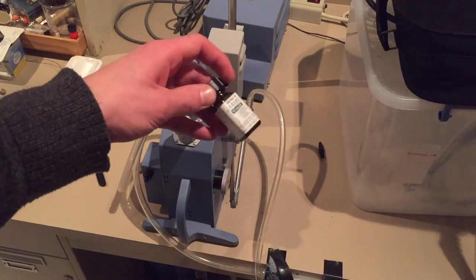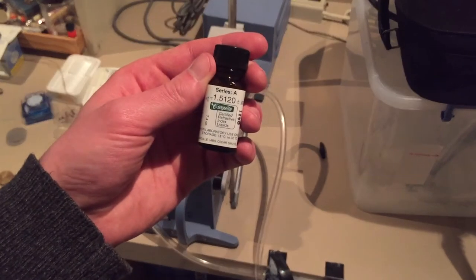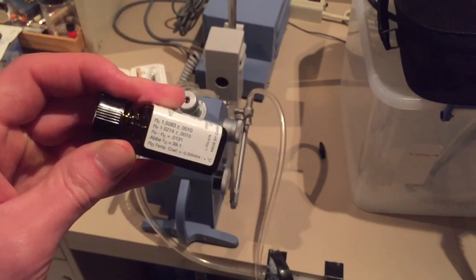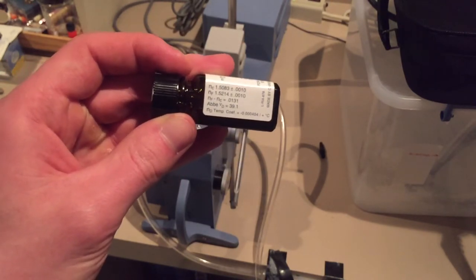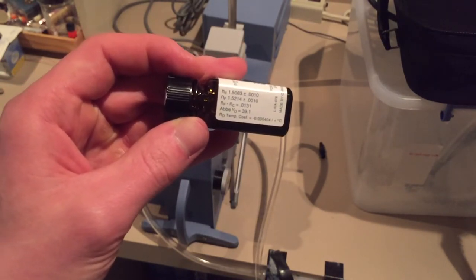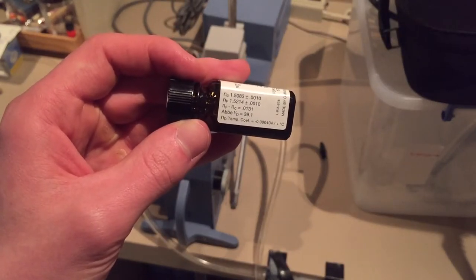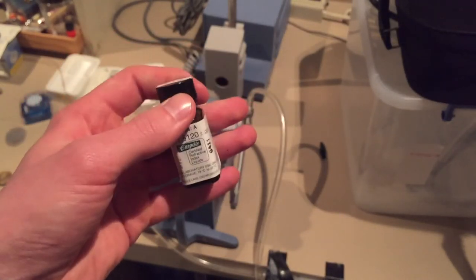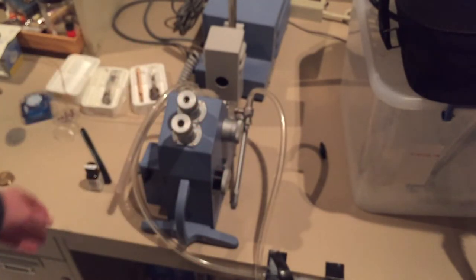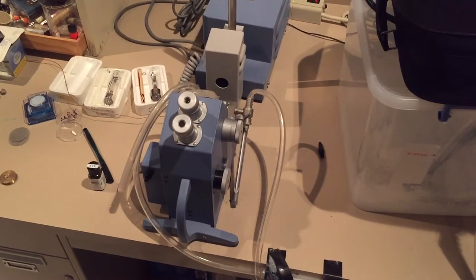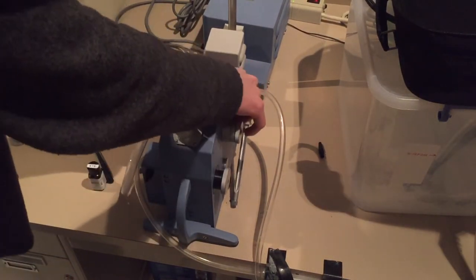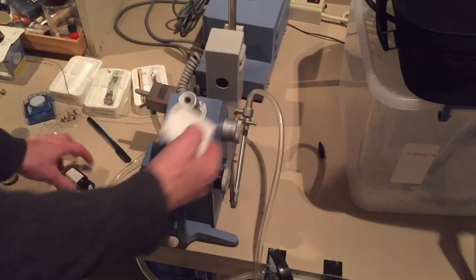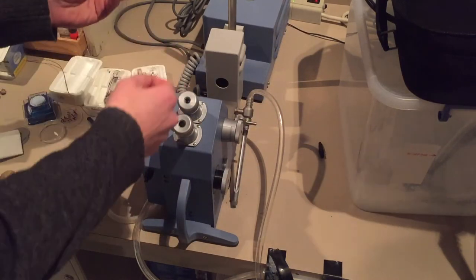Here we have the setup. I'm using this liquid, 1512, as I found out this is about what I need to use for alpha and beta on skolecyte. It has the characteristics listed on the side for different wavelengths of light. The main label is the refractive index at 589.3 and at 25 degrees C.